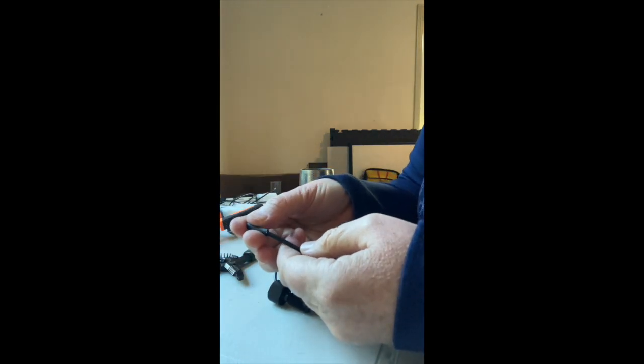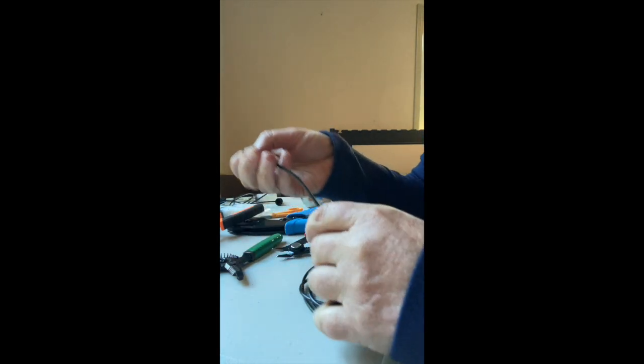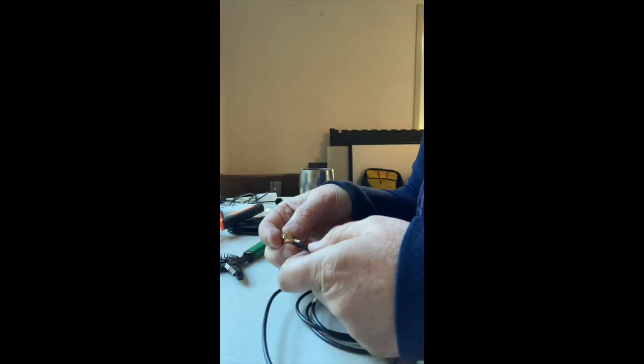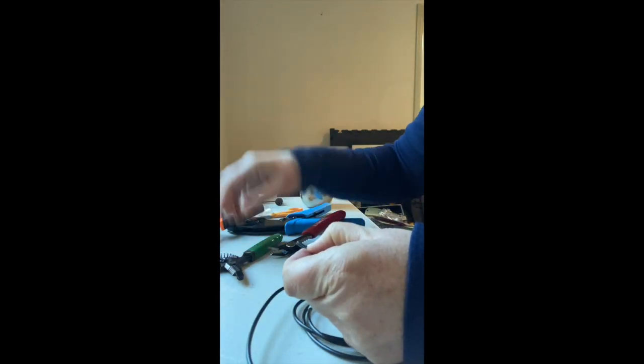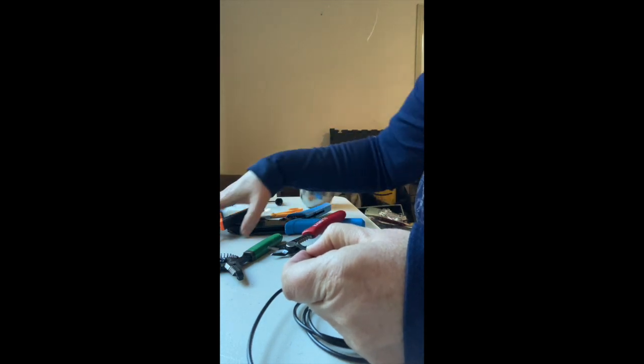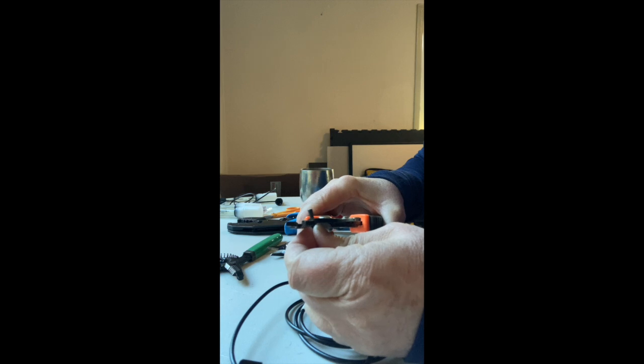Towards the new connector, we have some shrink wrap and the crimp tube. It's a bit easier to put on before we strip the wires. I'm going to strip the outer part of the wire a couple millimeters longer than the stem on the new connector. And that uses size 12.